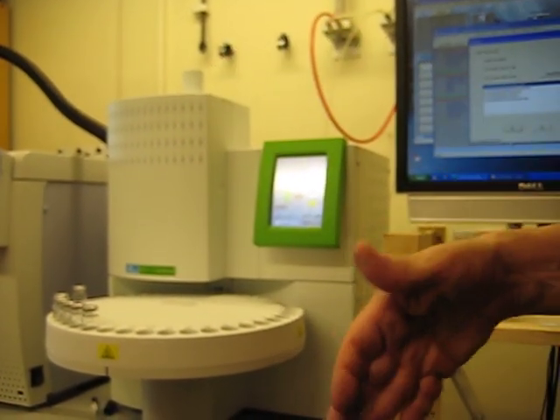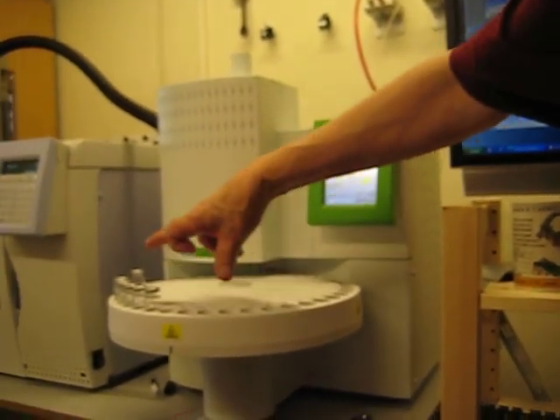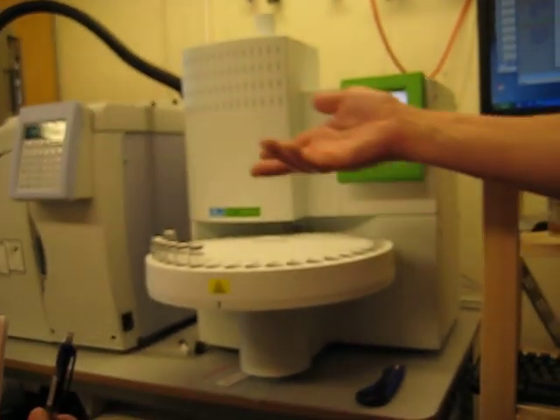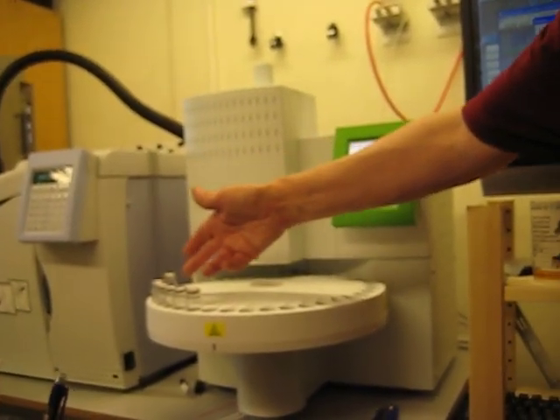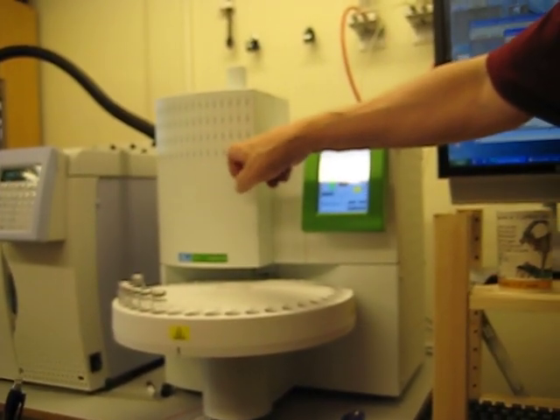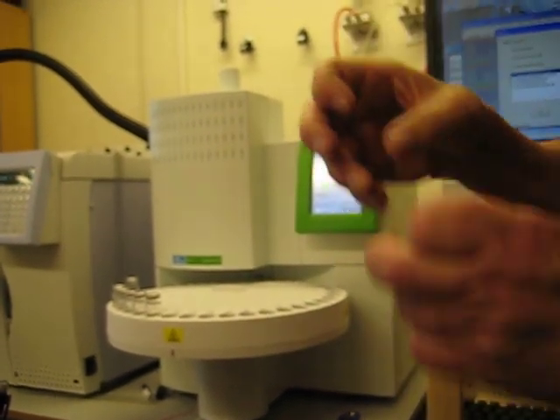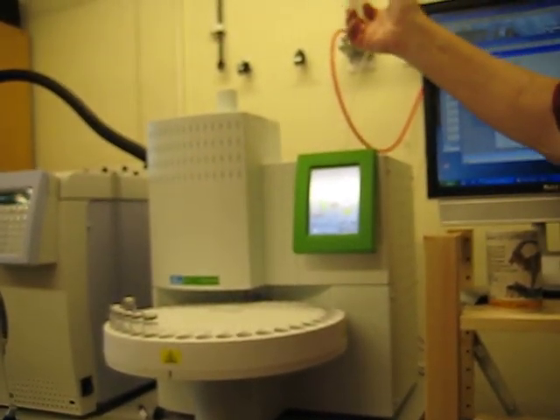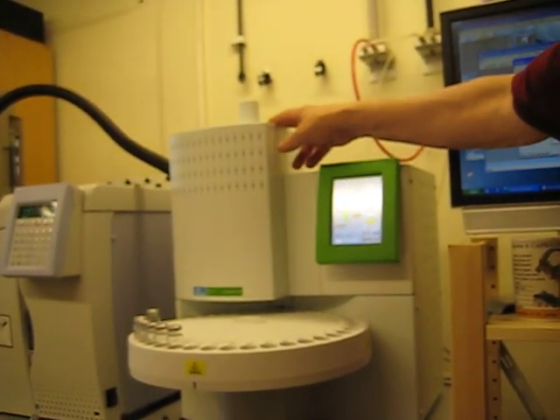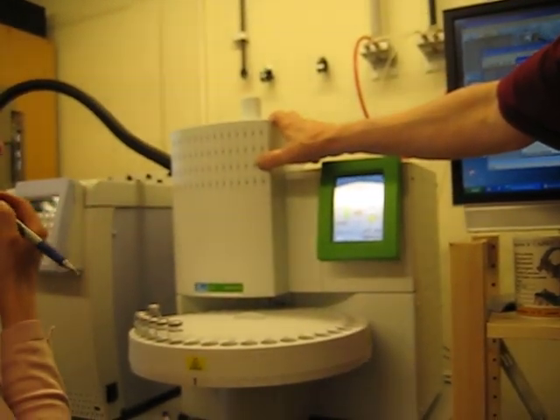So that will be dependent on, but in the case where this is rather short, and you say that you have already incubated for a long time, then maybe you don't need it to stay here a long time, because that would be like adding 1 minute to already 24 hours. This is too much. Yeah. And if it is at room temperature, it's already at room temperature. Because in Umeå, a run takes, I think, 2 hours.